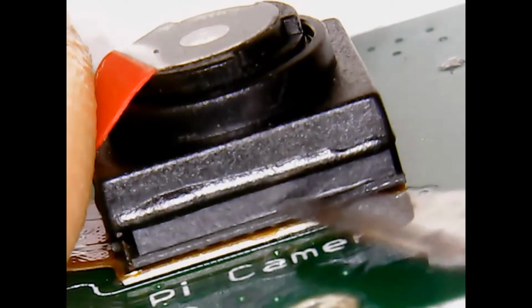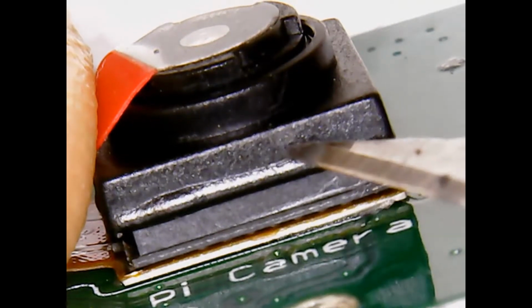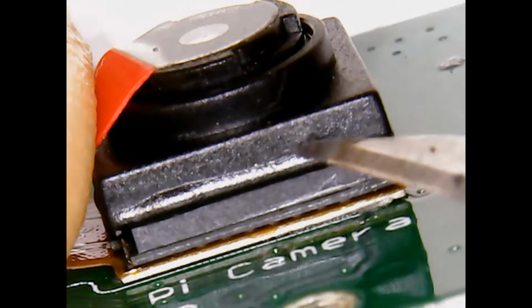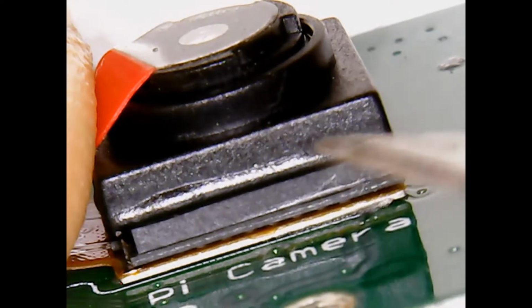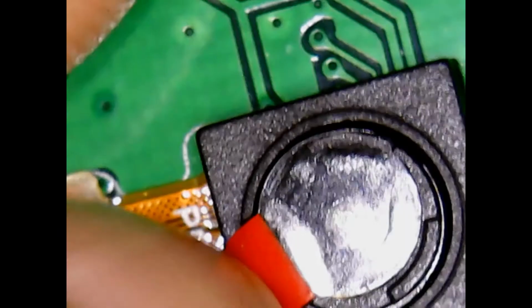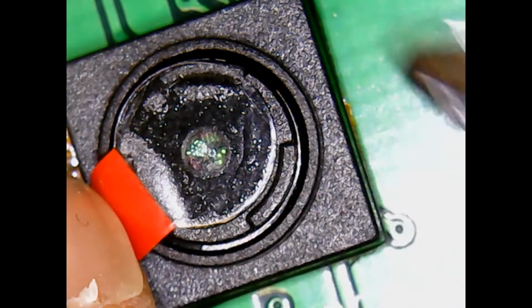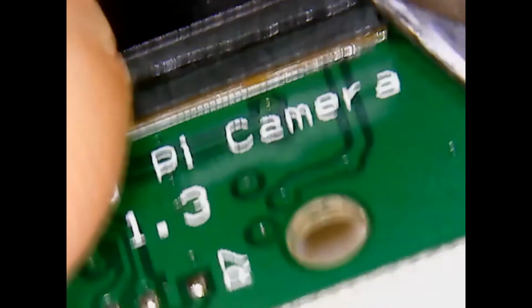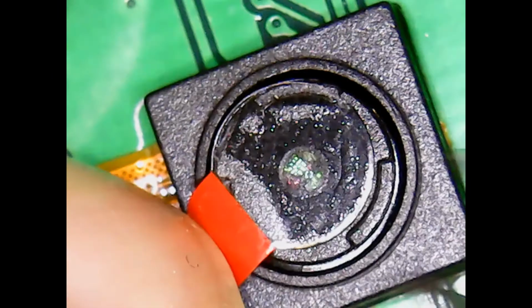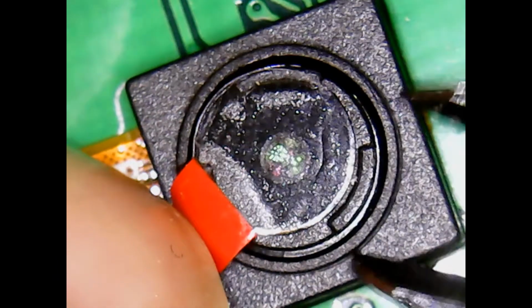So the key is to chomp away at the top. And you'll notice it'll part pretty easily because there's only about 4 spots where they hot sealed the top part to the bottom part. Okay, so the key to doing this is be slow and careful. Do little chunks at a time. So here's the rim that is part of the threads that hold the lens in place. We're going to start chewing on that. So don't come in here and think you're going to go boop, one big chomp. Really, you want to chew.